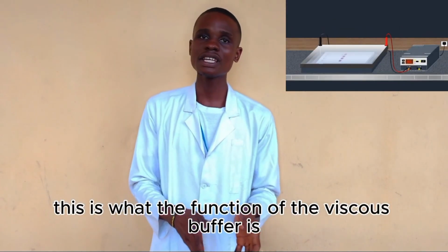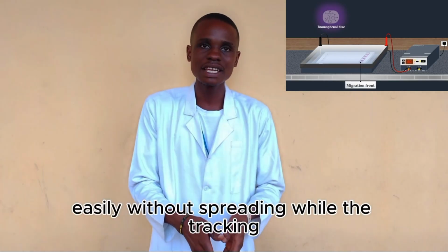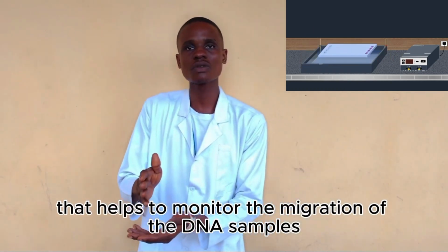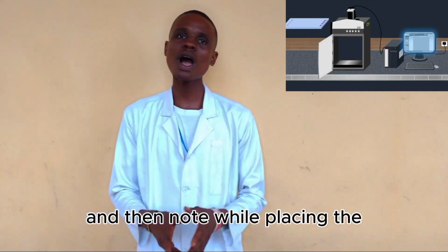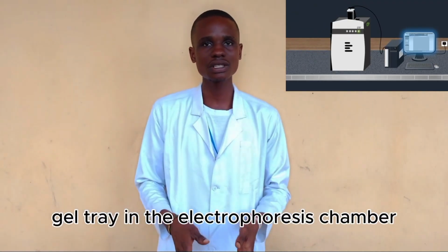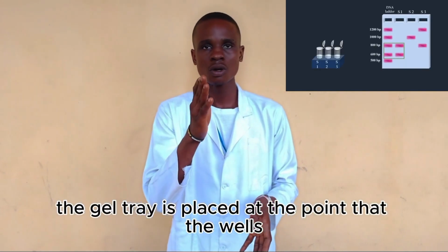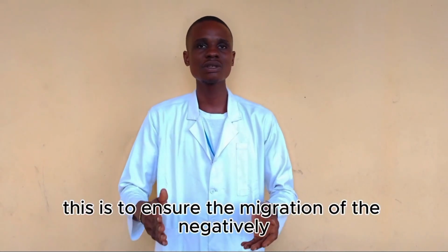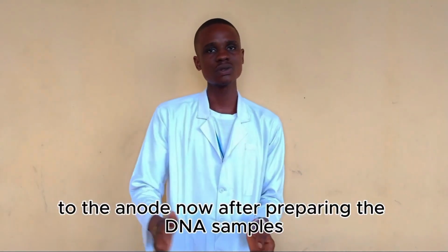Now, the function of the viscous buffer is to help the DNA sample to penetrate into the wells created by the comb easily without spreading, while the tracking dye helps to monitor the migration of the DNA samples from the cathode to the anode. And note, while placing the gel tray in the electrophoresis chamber, the gel tray is placed so that the wells created by the comb are at the cathode, while the opposite side of the wells is at the anode. This is to ensure the migration of the negatively charged DNA particles from the cathode to the anode.